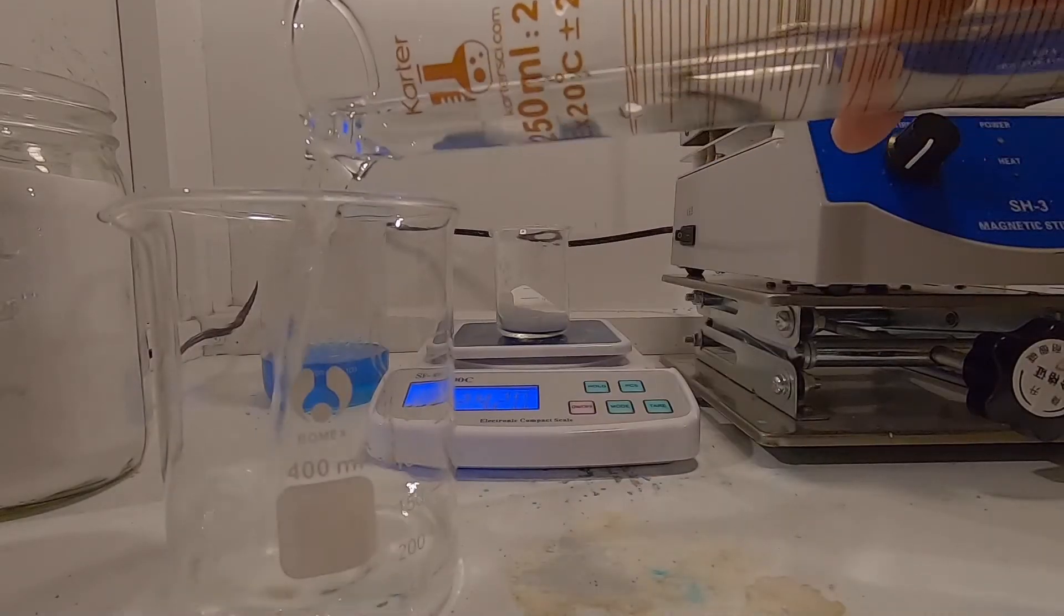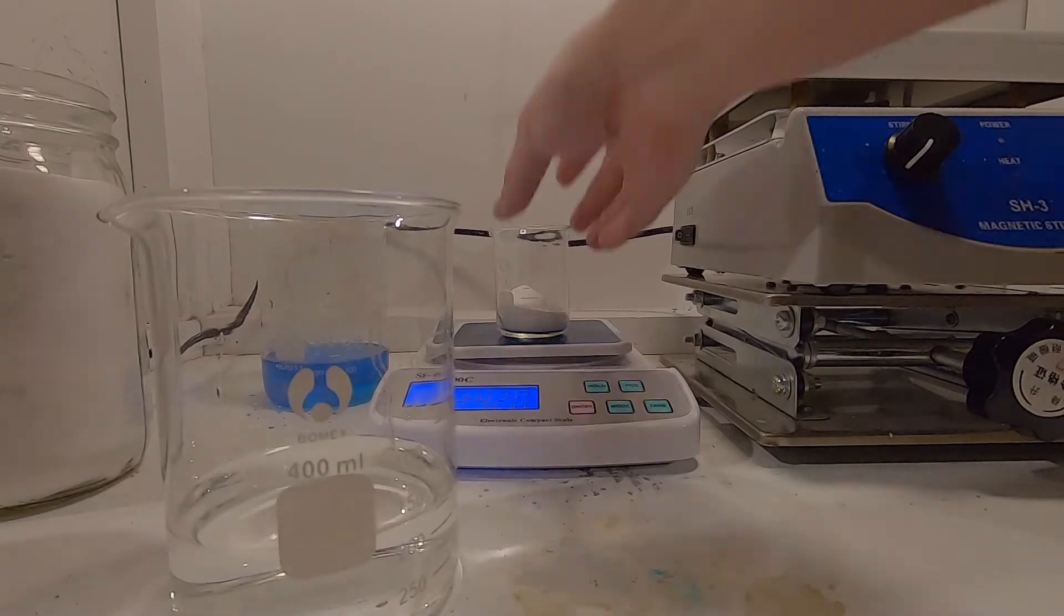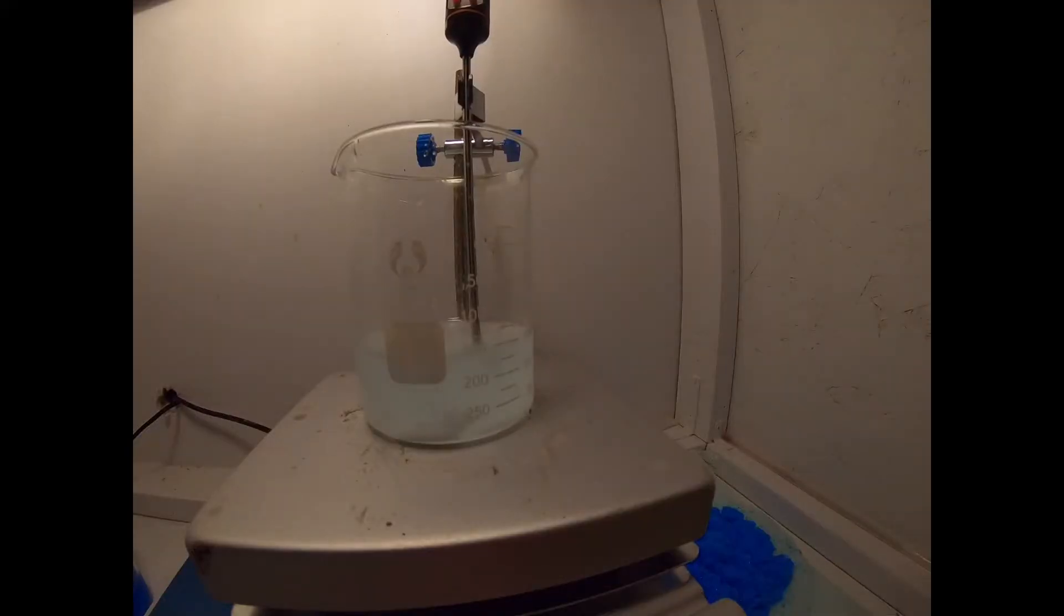Next I add 24 grams of sodium carbonate into 120 milliliters of H2O. I dissolve this with heat.